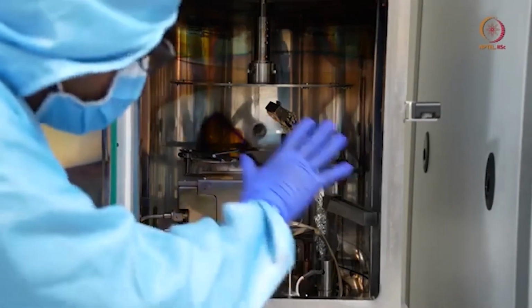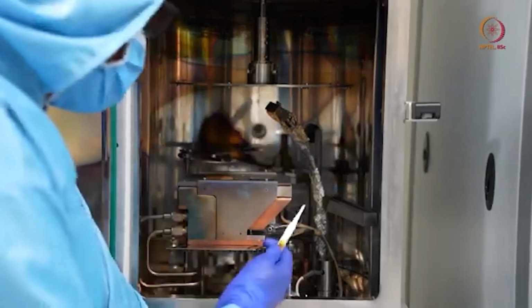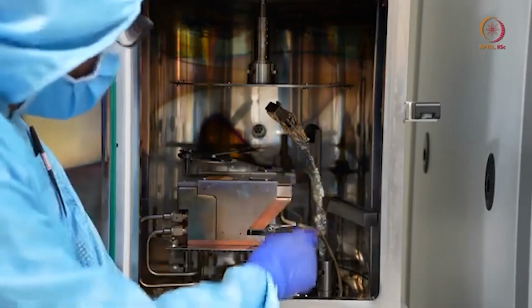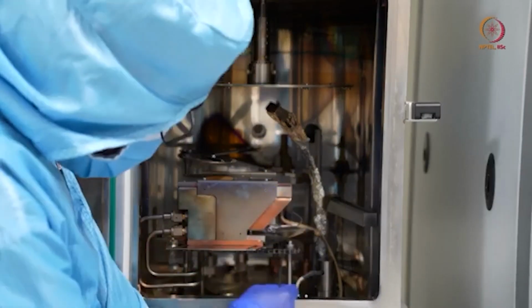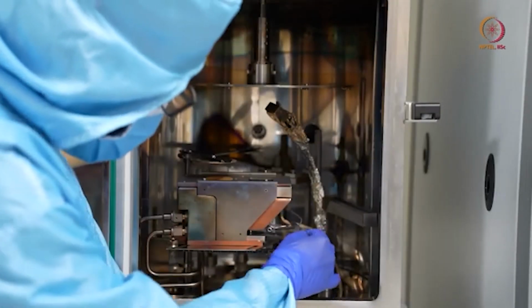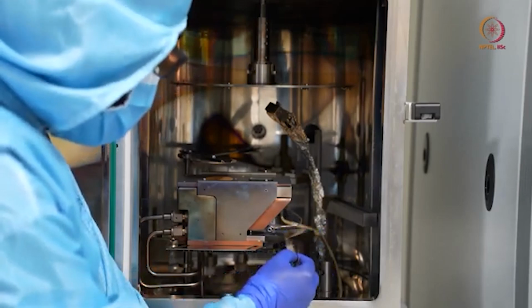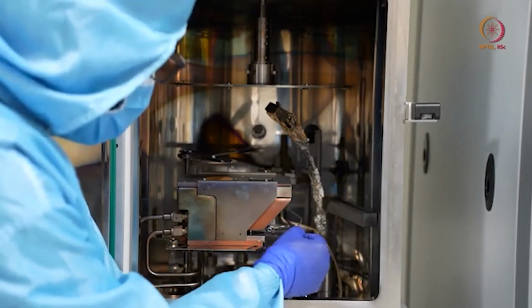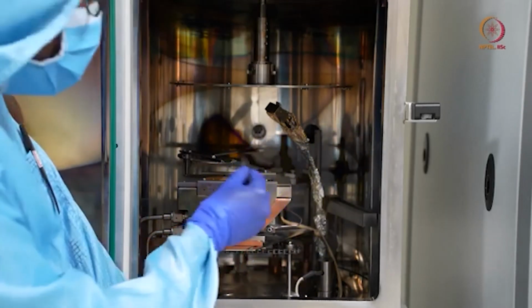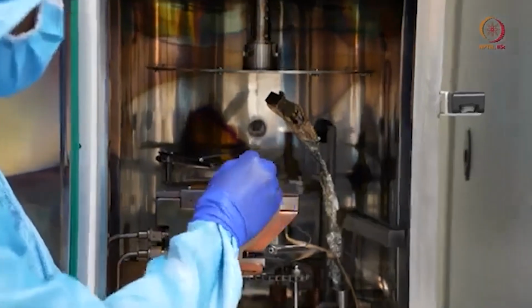Here this is the chamber inside. I don't want to touch the things. This part is basically for electron beam evaporation. You may not be able to see it here, but inside there is the filament. That filament will be heated and an electron beam will be generated and pass through this. Here we have one open area, a square rectangular open slot.